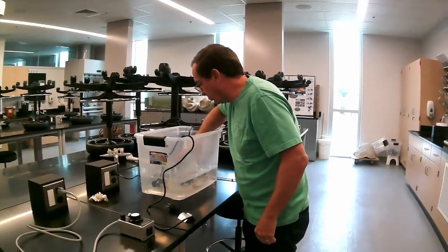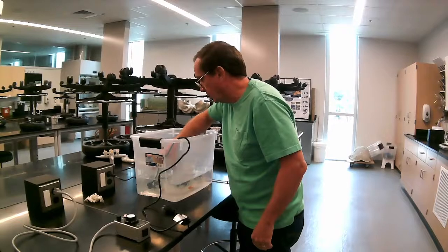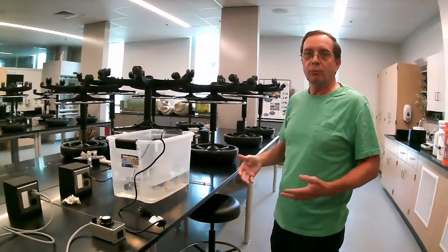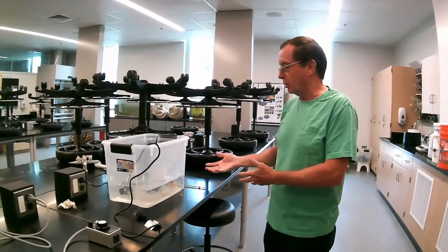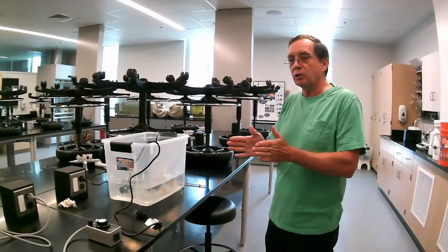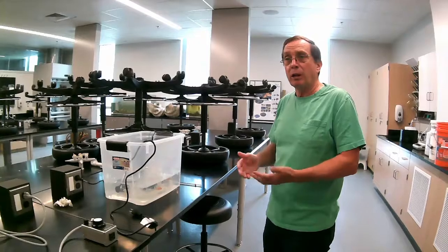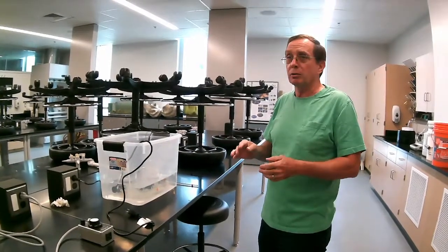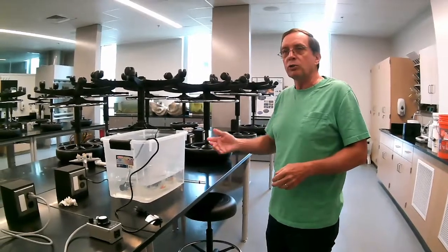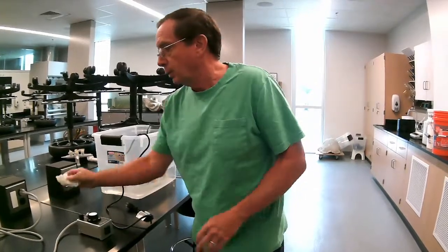Again, give a little space in between each one of the beakers so that the water circulation is complete. It's not unusual for one of the glasses, or one of the holding tanks, to be a little bit warmer than the other. Keep in mind that as long as we stay within that range of temperature increase, that's not going to matter. The CT max will be the same. So if it's 0.4 in one, but 0.5 in the other, one will finish first, but they'll still reach the same or close to the same temperature.